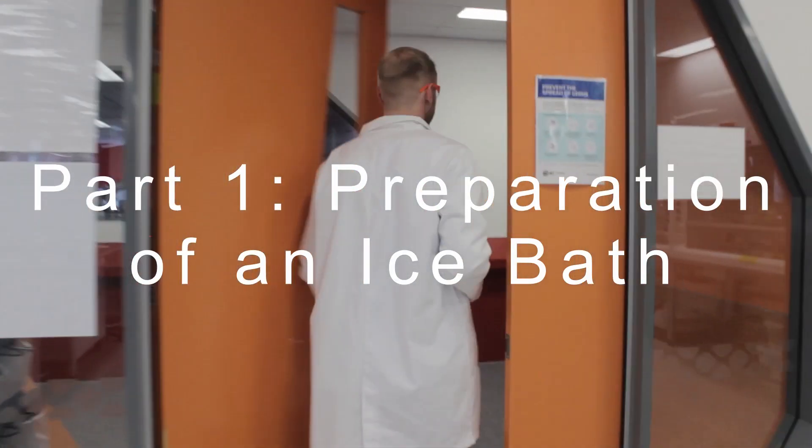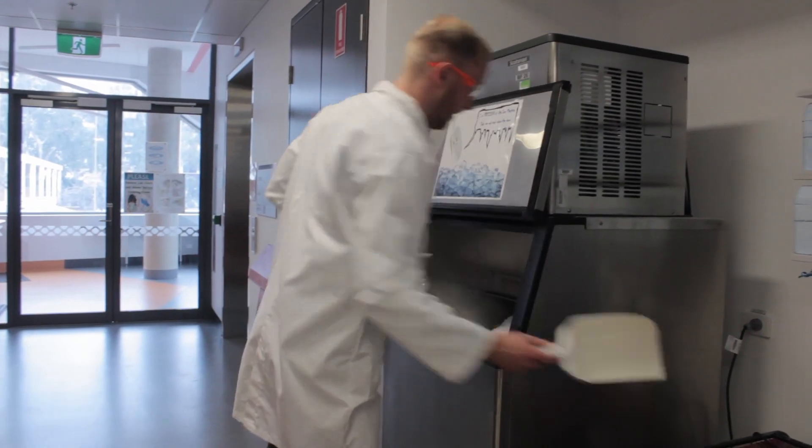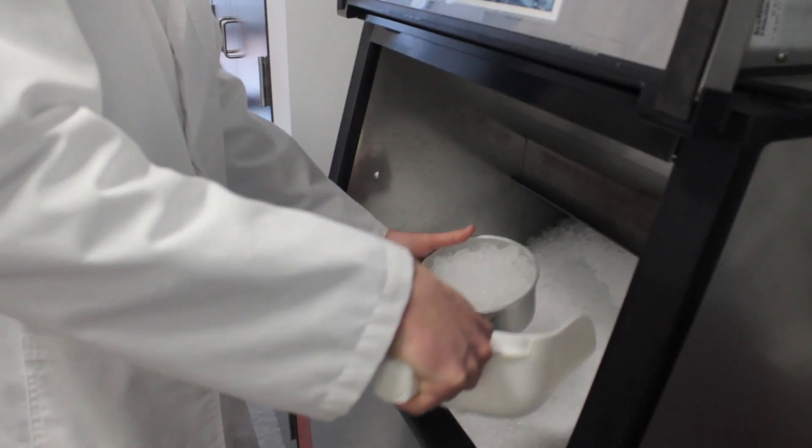Now let's prepare our ice bath. First go collect some ice from the machine in the hallway, remembering to close the lid when you're done.